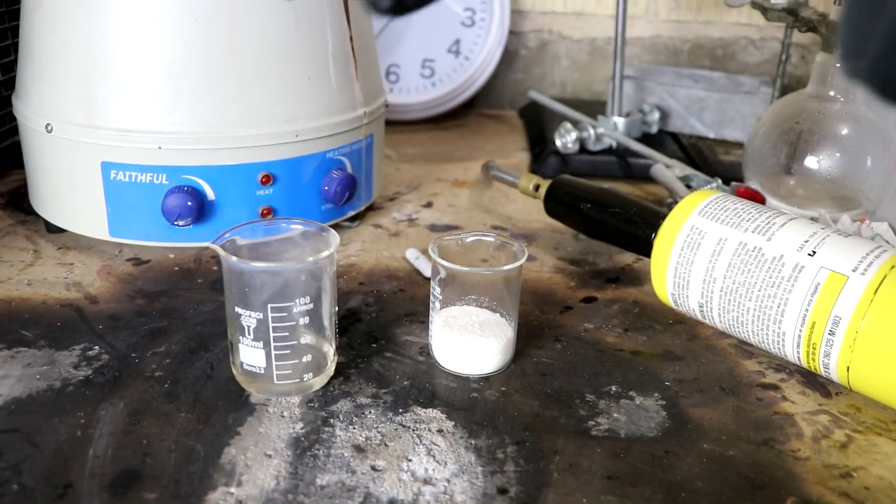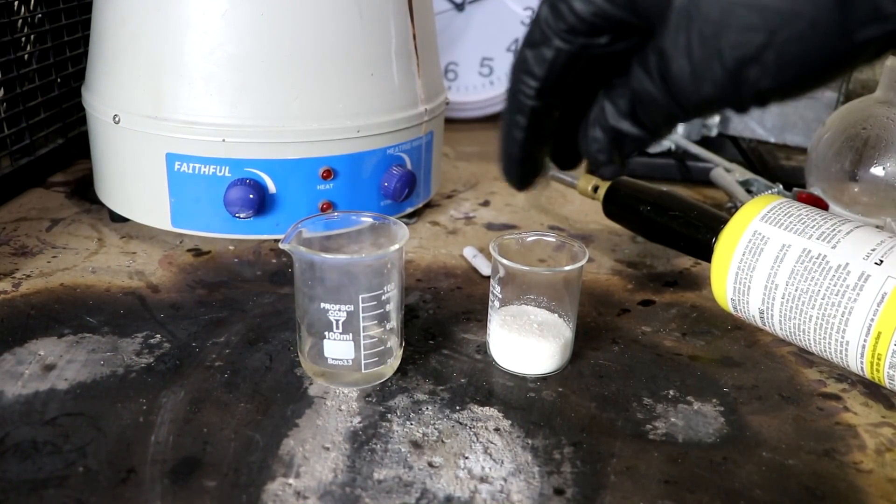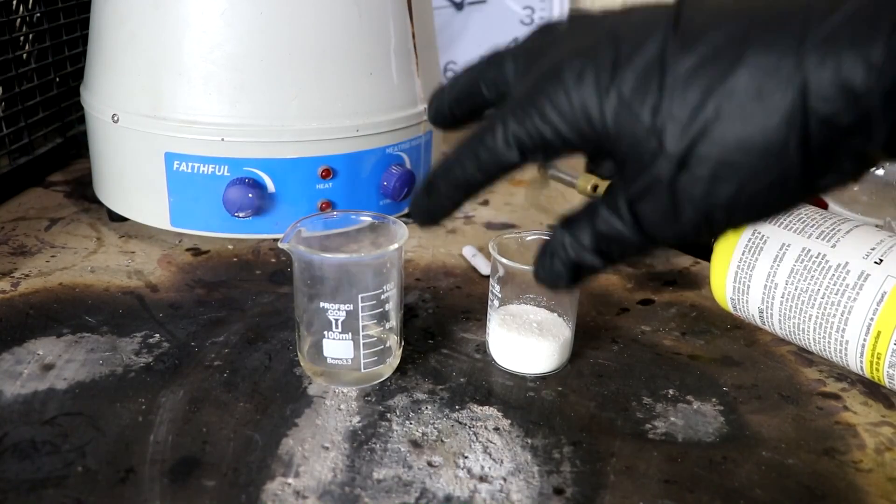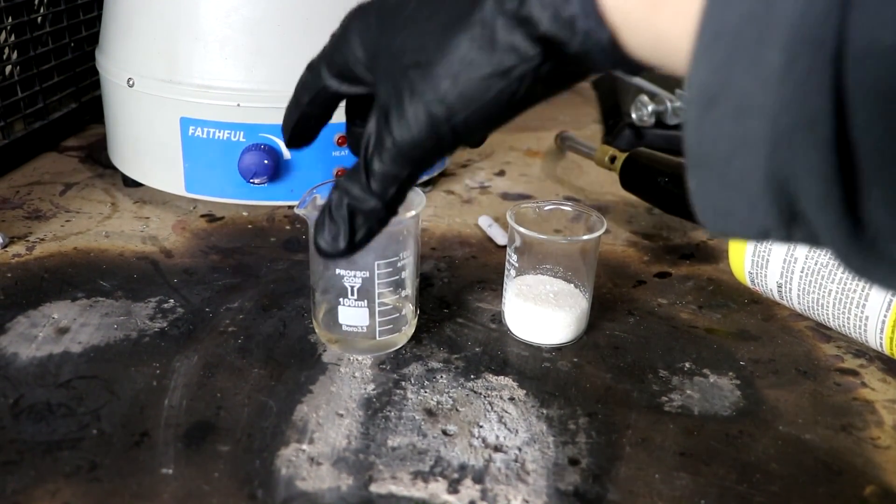Not very much. Certainly less than the amount that I used to produce the sulfur dioxide. But that's not the point. The point is that I was able to take the sulfur dioxide and convert it into the acid.